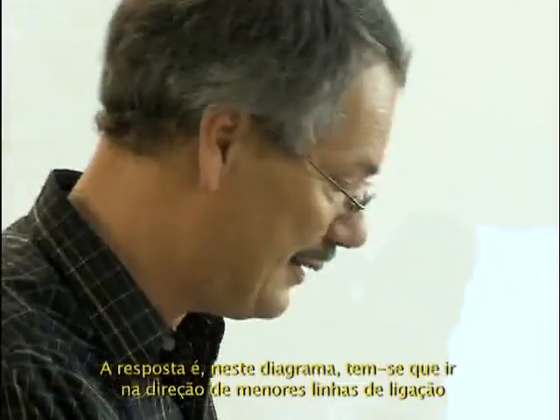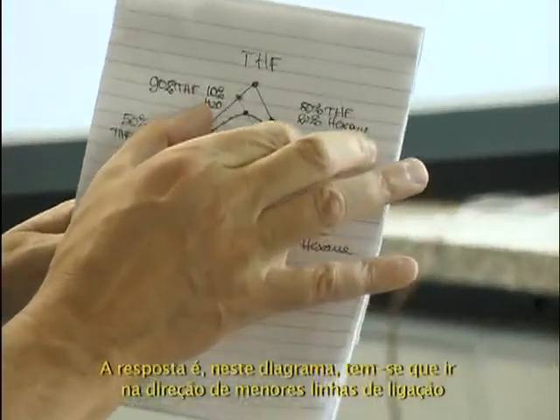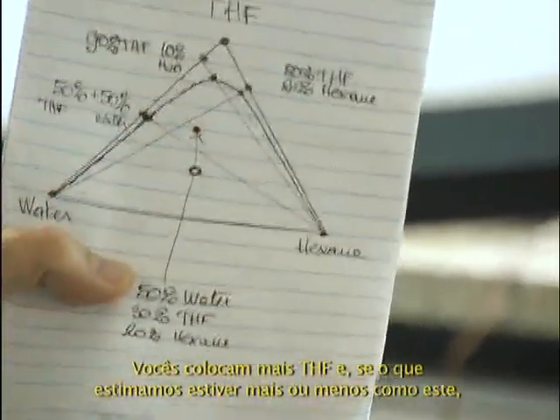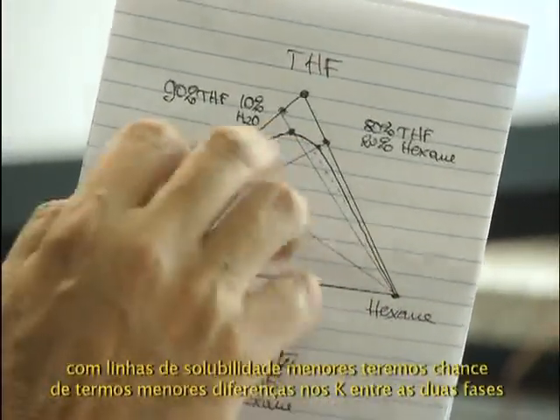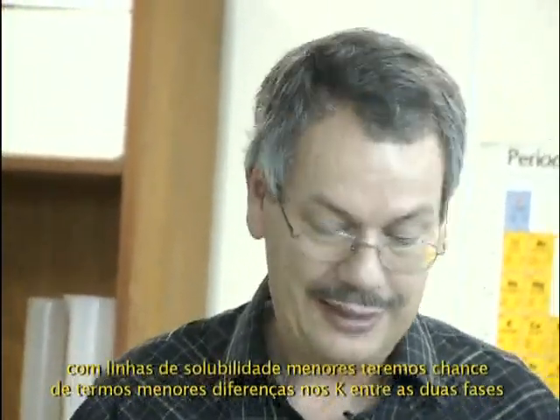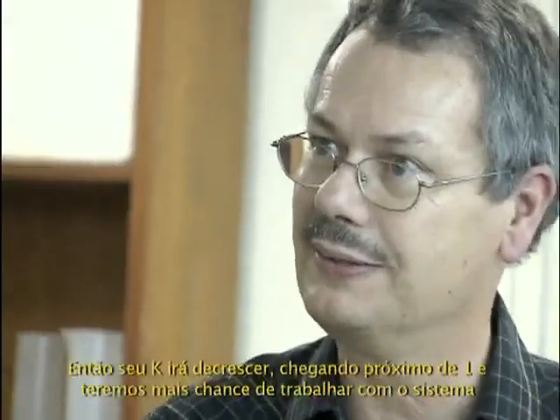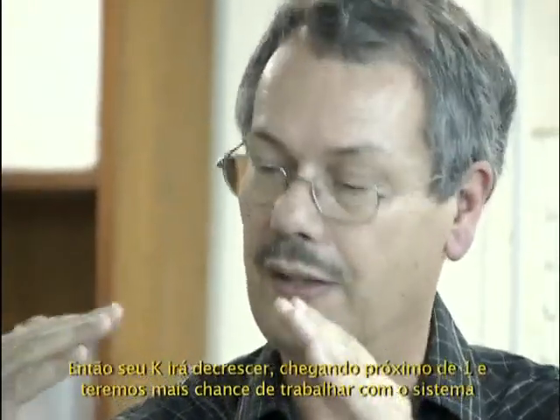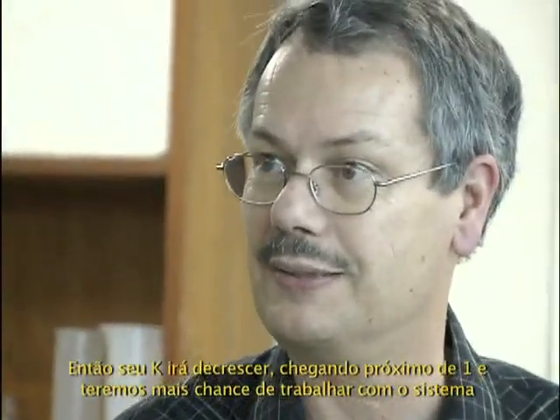The answer is, in this diagram, you have to go with a tie line which is smaller, which means put more THF. If you put more THF, and if the one we estimate is a little bit like this, you go with shorter tie lines, and you are more likely to have less difference between the two phases, and your compound will partition better. So the partition constant will decrease, getting closer to 1, and you have more chance to be able to work with this system.